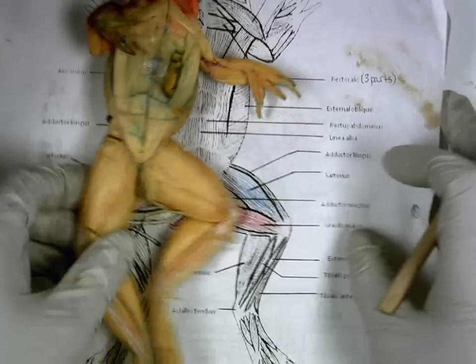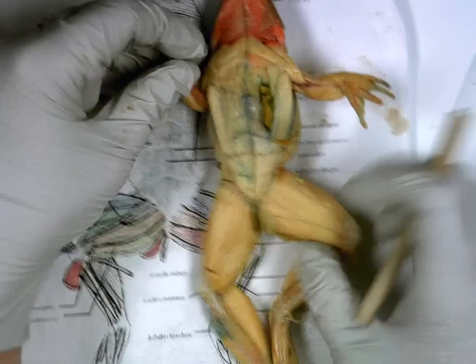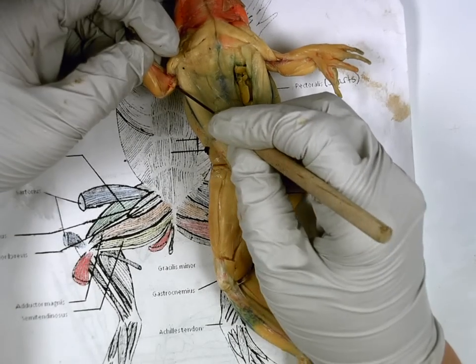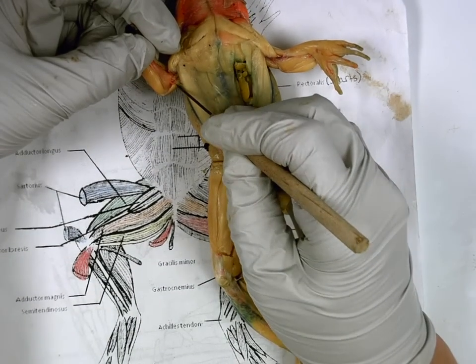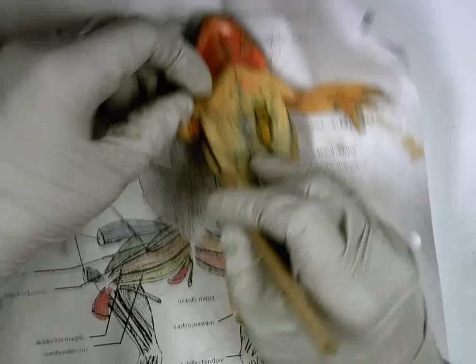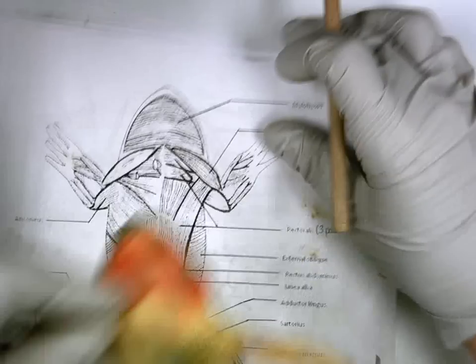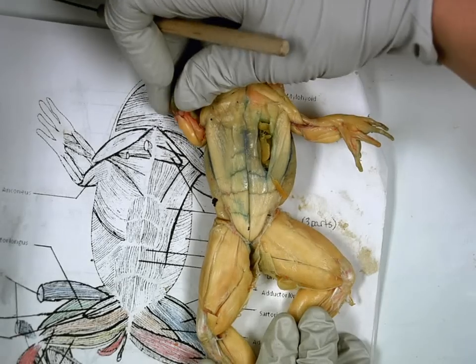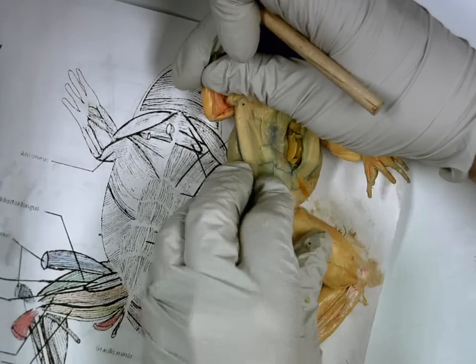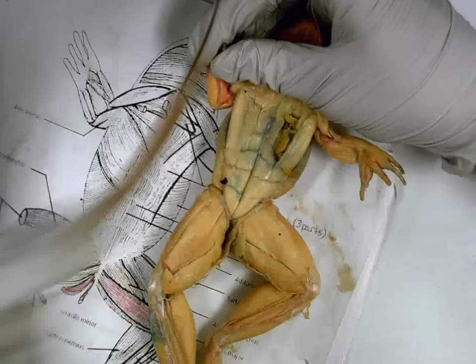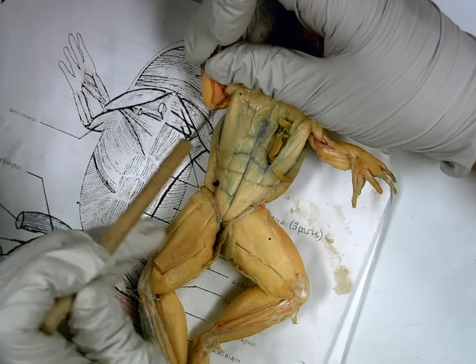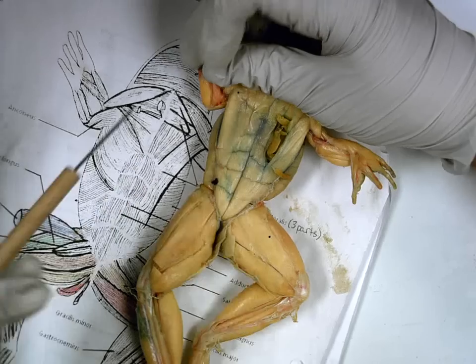Let's rotate to the other side. If we go to the other side, we pull out the arm again, the bottom muscle arm. It's the same as the back. It's called anconeus. Let me rotate my little diagram here. If I pull out the arm, this one right here, bottom one, same as this bottom one, anconeus.